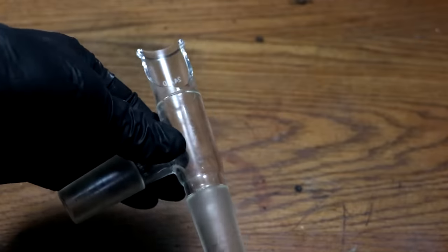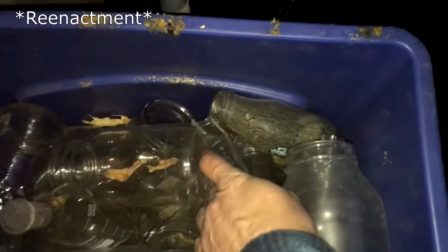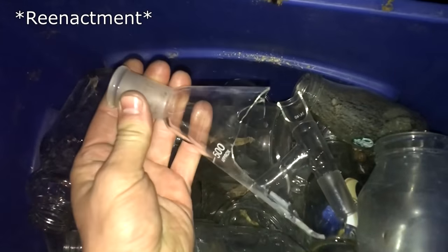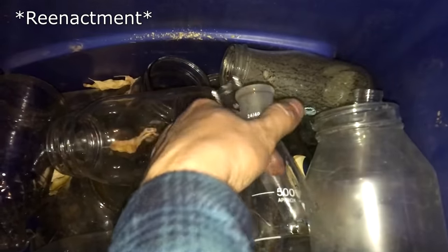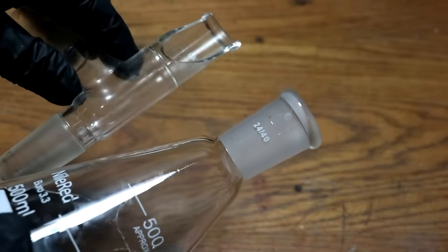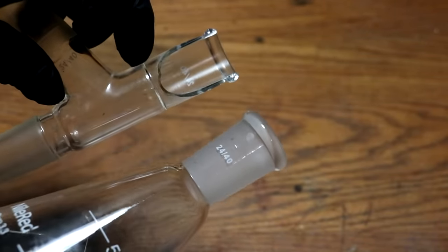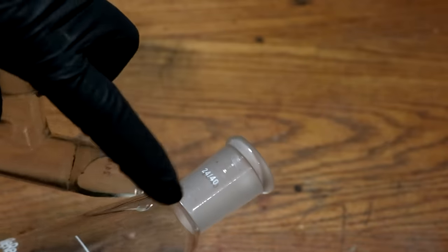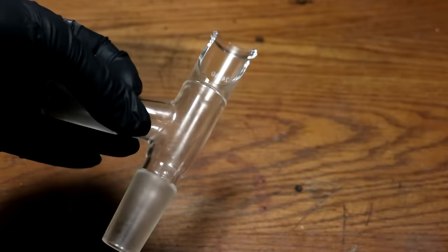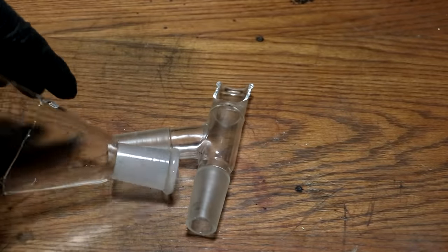So I was going to throw this away and buy another one, perhaps one that actually has a ground glass fitting, and I saw that I had another piece of glassware that was broke that did have a ground glass fitting. And it's the right size and everything. And I was wondering, could I take this one off and put it over onto here? Basically, cut it here, and then weld them together and make a distillation adapter and save my 30 bucks. Well, let's find out if I can do it.